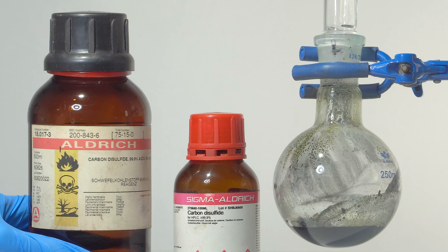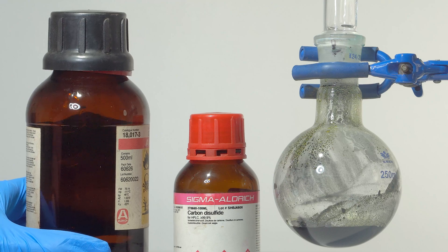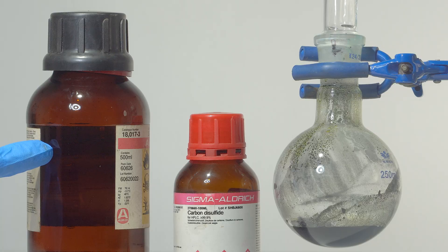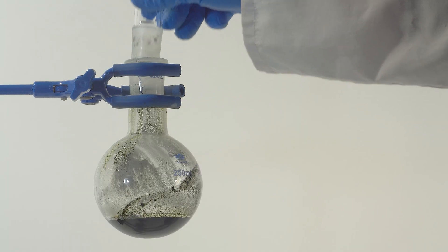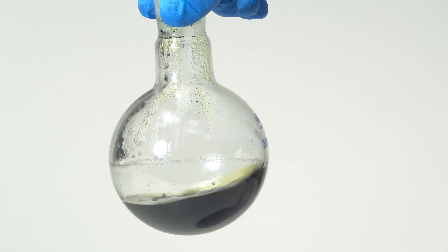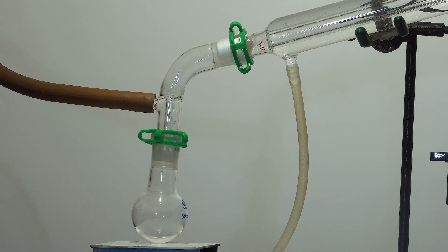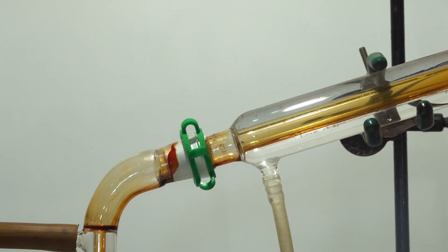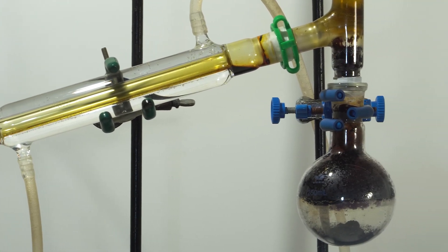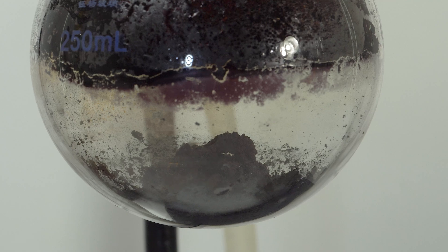Next you need to drain off the unreacted disulfur dichloride and wash the precipitate with carbon disulfide. Note that carbon disulfide is properly stored under a layer of water, which is why you see two layers of liquid here. I wash the precipitate with carbon disulfide and distill it along with the remaining disulfur dichloride in a vacuum, thus receiving pure dry vanadium trichloride.